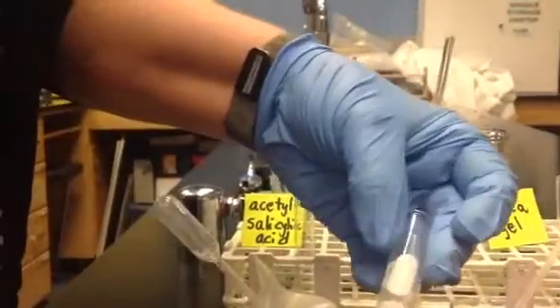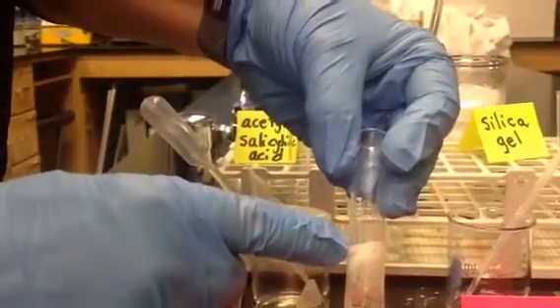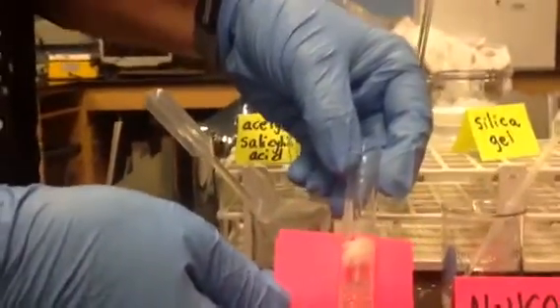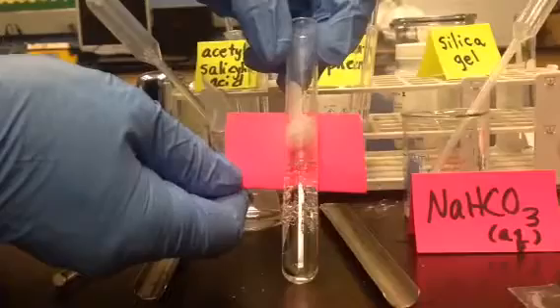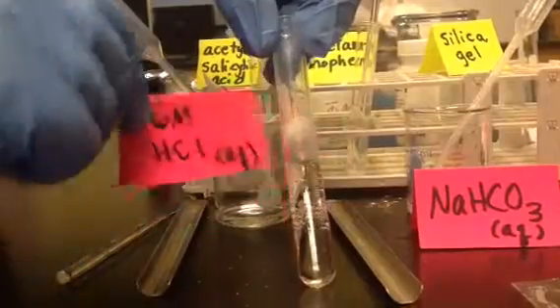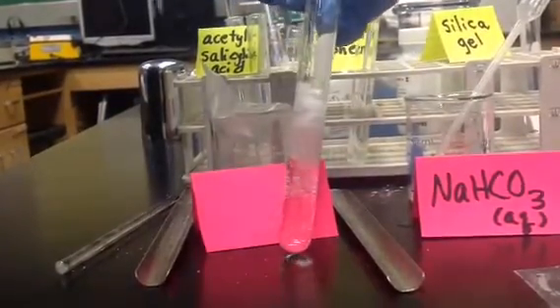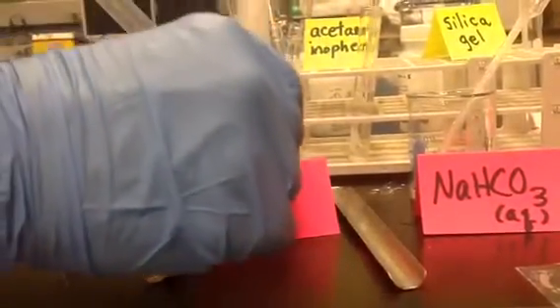Or is it? Do you see how I recrystallized the acetylsalicylic acid? It's at the top. The bubbles are just the CO2 from the acid-base neutralization. But this was, maybe you can see it on the pink better. It recrystallized when I added acid back to the solution. It forced the acetylsalicylic acid to precipitate, if you want to think of it that way. And I'll keep adding. Let it react. Whoop, I got a little too wild.